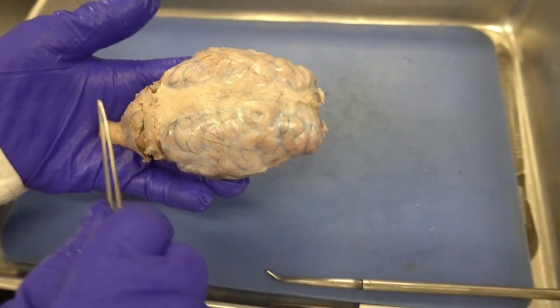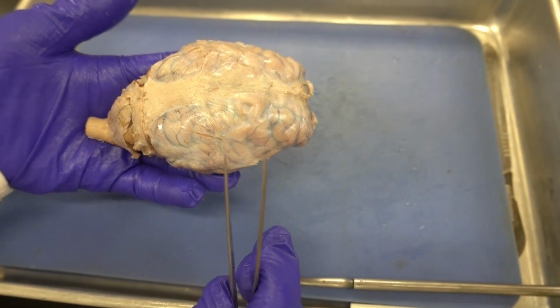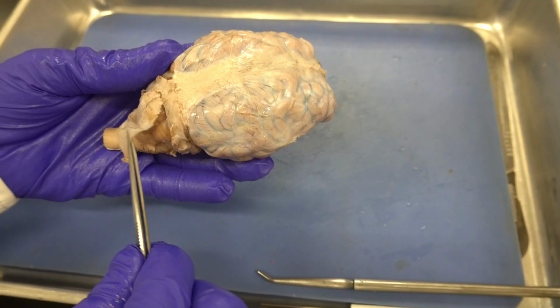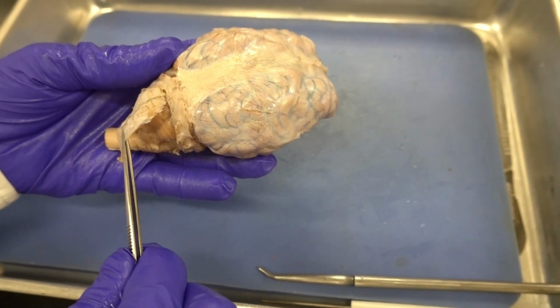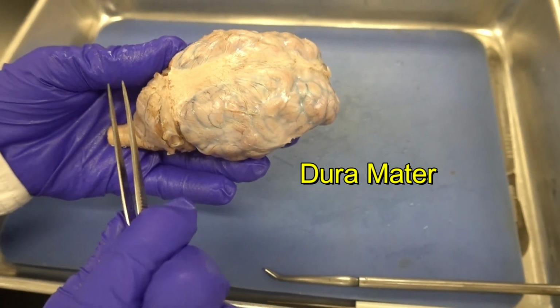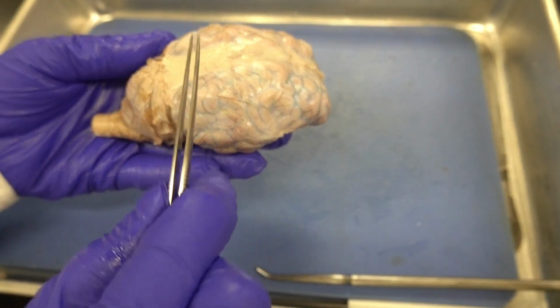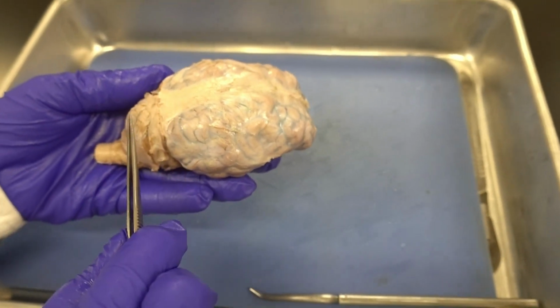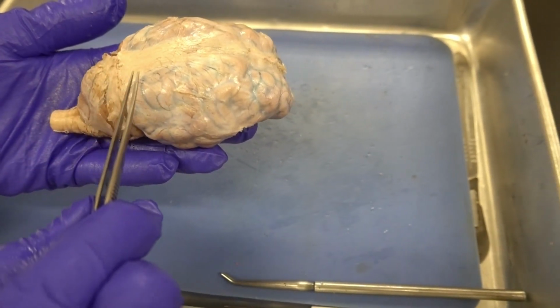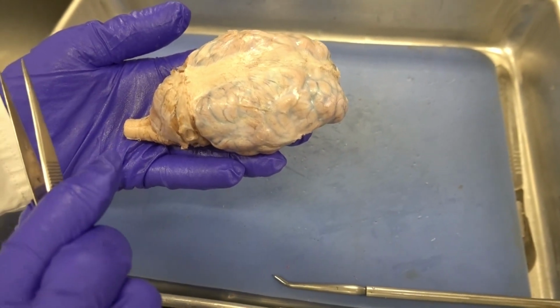I have a sheep brain, and even though it's much smaller than a human brain, we can identify all the structures that we intend to. First, I pay attention to this white, strong layer that is called dura mater. This is one of the three meningeal membranes that cover and protect the brain. Please note that the three meninges of the brain continue with the three meninges of the spinal cord. So whatever we learn about the meninges of the brain, we will repeat when we talk about the spinal cord.